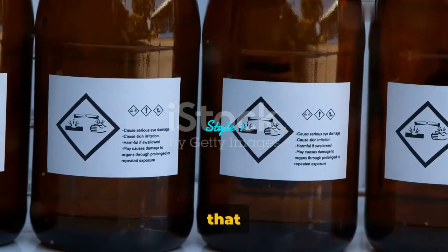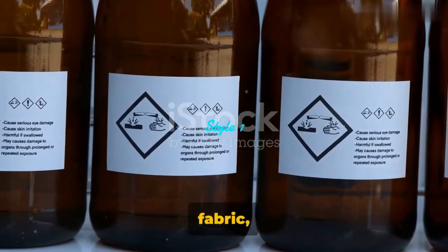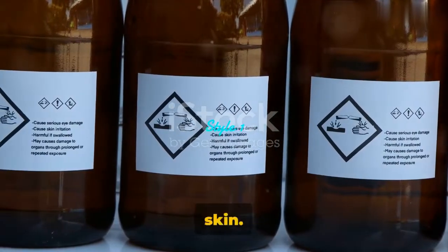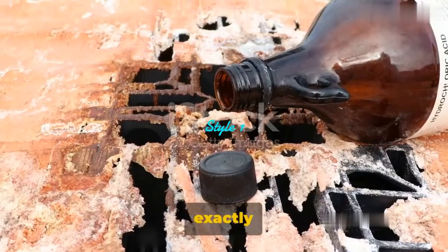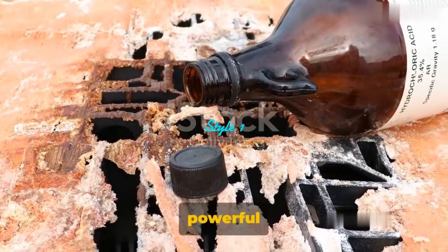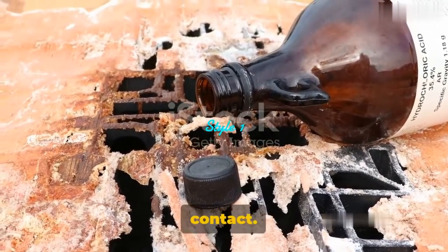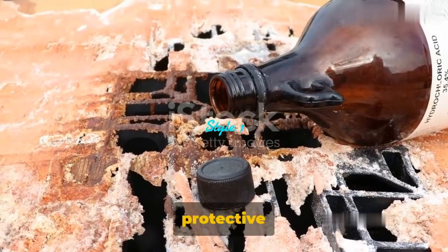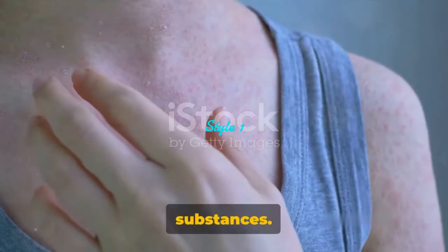Imagine a droplet that eats through metal, disintegrates fabric, or worse, burns through skin — it's not a pretty picture. That's exactly what corrosive materials can do. They are powerful enough to break down other substances on contact. This is why protective gear is essential when handling these substances.